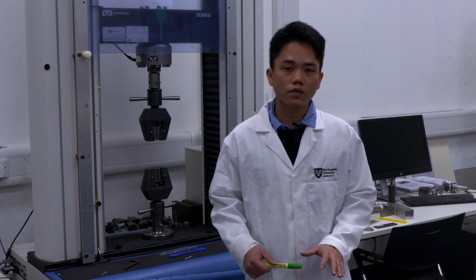I would like to explain a little bit how important the tensile test is. In reality, when you design something, you need to find a suitable material: how strong the material is for your product, how brittle, how ductile. That's a very important requirement for product design. The tensile test provides you many mechanical properties, for example the modulus of elasticity, the tensile strength, and the ductility and brittleness. All of them are very important.